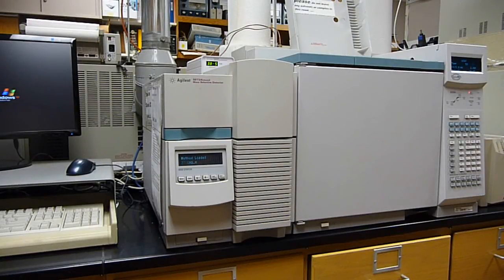This is an Agilent 5973N GC mass spec that we've had in operation now for over 15 years. And let me go over the number one trick to keeping this instrument functioning as an open access instrument for over 15 years with 95% plus uptime.